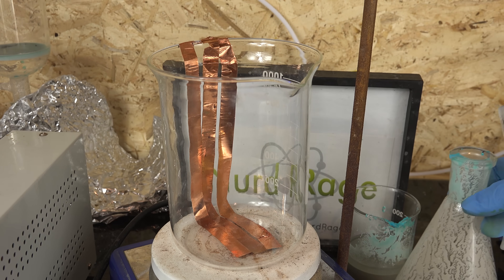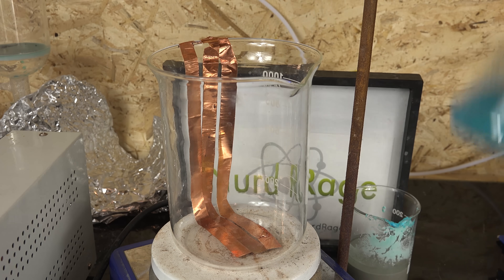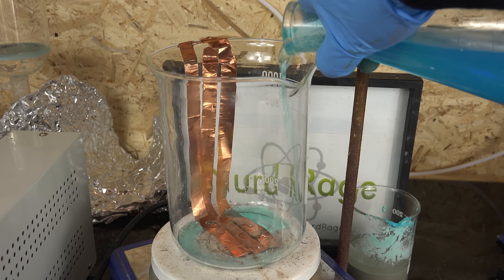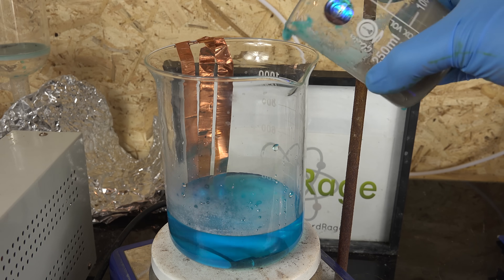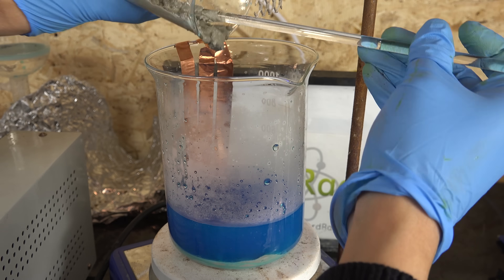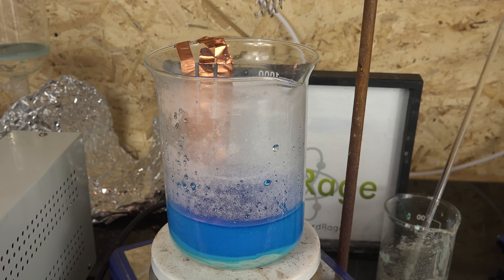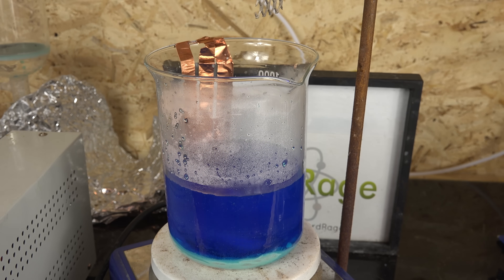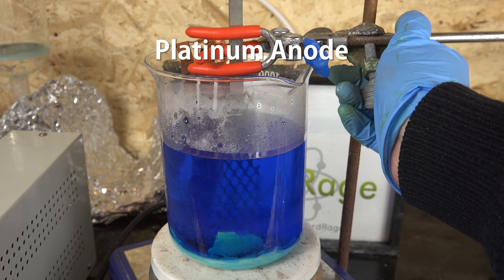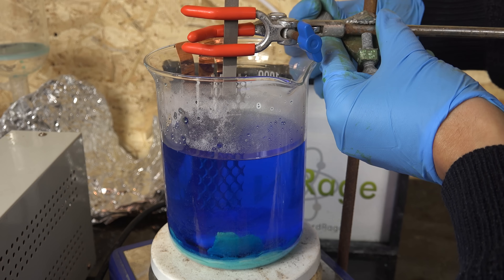If you don't have the electrode on the bottom you'll need to stir later. Now we get our 600 milliliters of water that we measured earlier and first we use a bit to wash out our various apparatus of the copper sulfate and sulfuric acid. At this point the numerous transfers between flasks and beakers has left a lot of sticky residues. We pour that water into our electrolysis cell and then we pour in our slurry of copper sulfate and sulfuric acid. You'll notice I poured in the water first and then the sulfuric acid slurry, because if you distilled it correctly this should be fairly concentrated sulfuric acid and will heat up considerably when added to water. The old rule of adding acid to water rather than water to acid applies here. We use the rest of our water to wash out the beaker. Stir the solution to dissolve as much of the copper sulfate as you can, but you won't dissolve it all. We now lower in a platinum anode and suspend it so it's equidistant away from most of the copper.